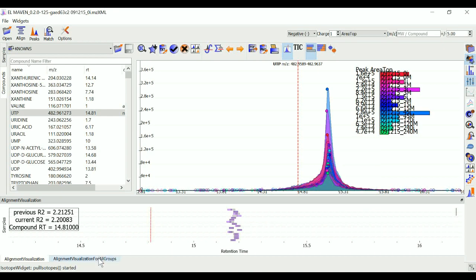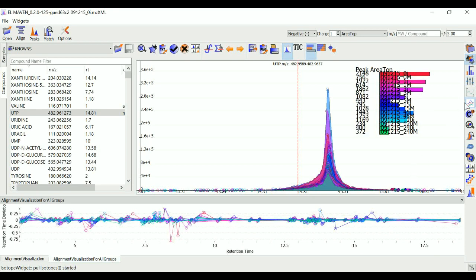You can click on alignment visualization for all groups, the widget for it is here. This graph will show you the total deviation by all the peaks, all the groups in your data. You may run alignment again with different parameters if required, or with a different alignment algorithm, until you are satisfied with the results.